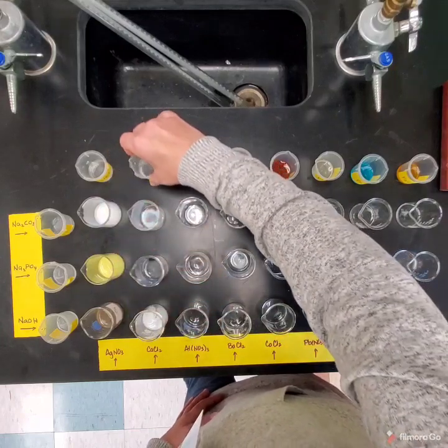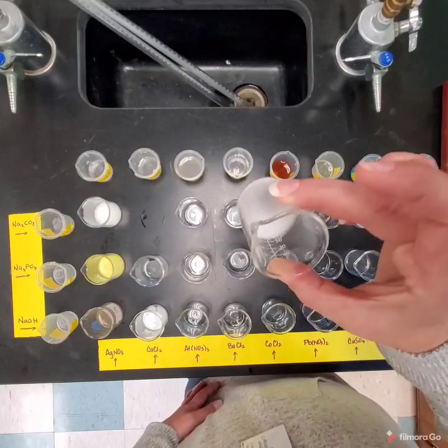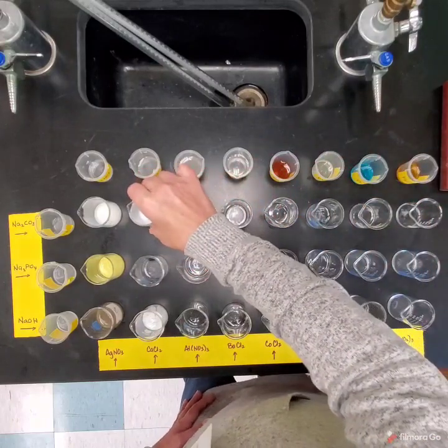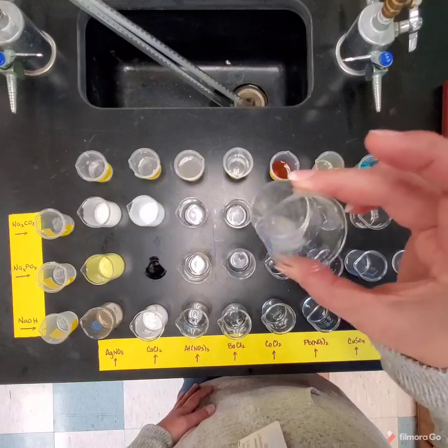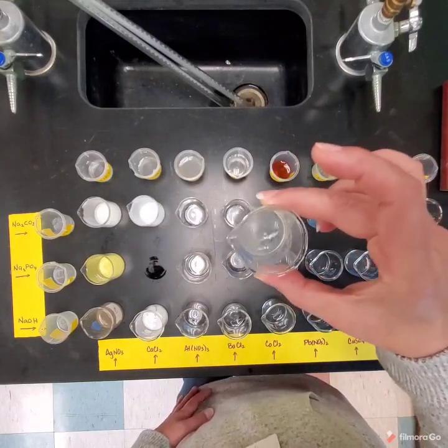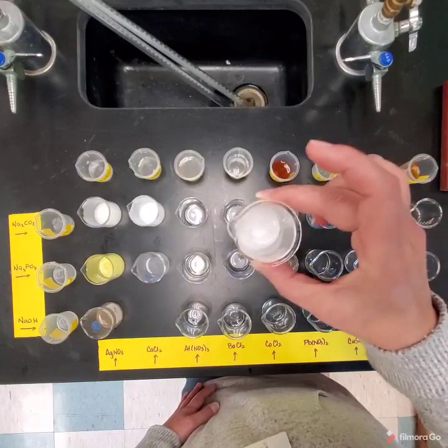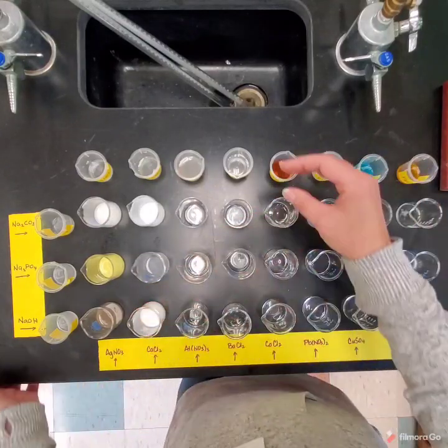Now, each of these precipitates can be kind of clumpy, can be kind of gel-like. I don't know if you can see this one, but it's a little goopier. It's thicker than the other one. They can be powdery. Okay, this one you can see it's a little bit forming, and this one's a little goopier as well. And this is one that would be powdery. See, it's still sort of liquidy. And if we let it sit, you're going to see the powder sink to the bottom.